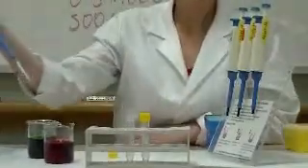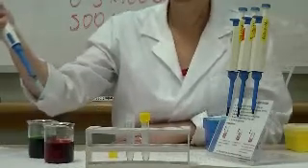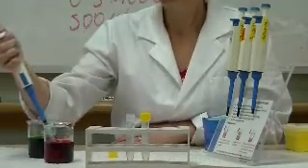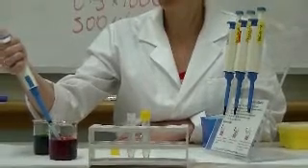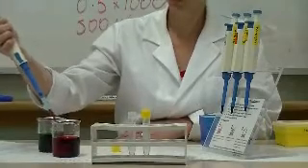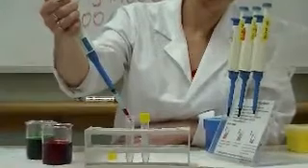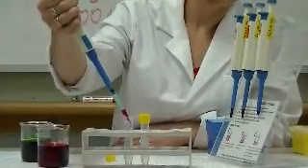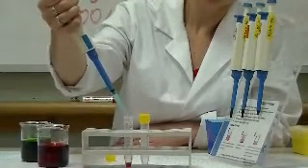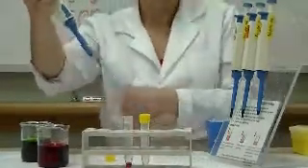Then I need to depress the plunger before I put the tip into the solution to the first stop. Immerse the tip halfway into the solution and then gently and steadily allow the solution in to the tip. Place the tip on the side of the vessel that you are putting solution into, and again slowly and steadily depress to the first stop and then all the way to the second stop. And then I will dispose of my tip into the waste bucket.